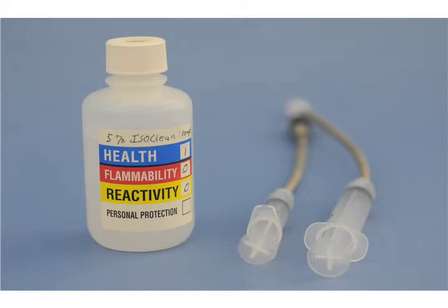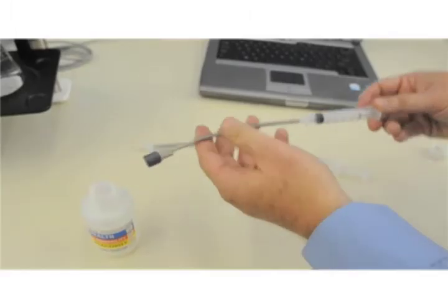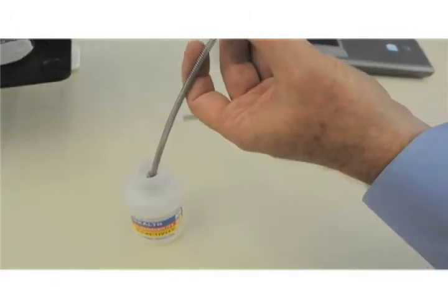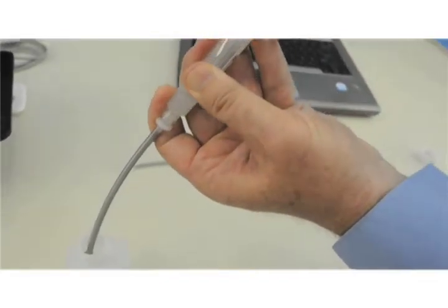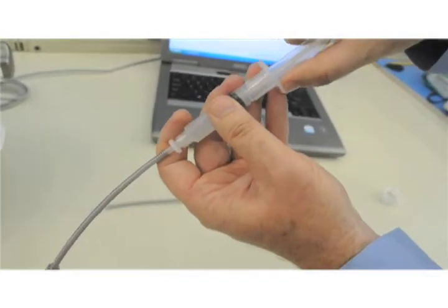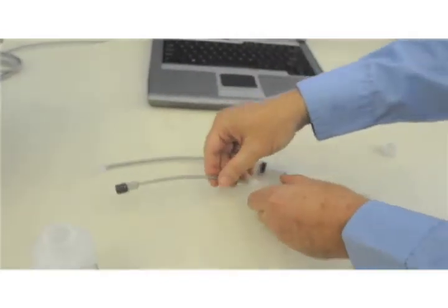Retrieve the cleaning syringes that were supplied in the accessory package sent with the system. Open the bottle of diluted cleaning solution and fill one of the syringes about 50 to 75% full.